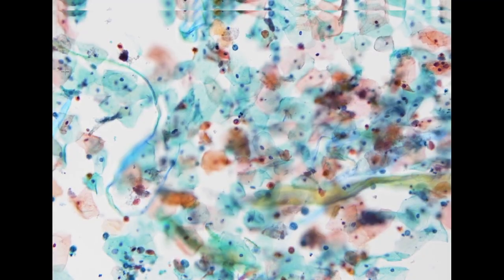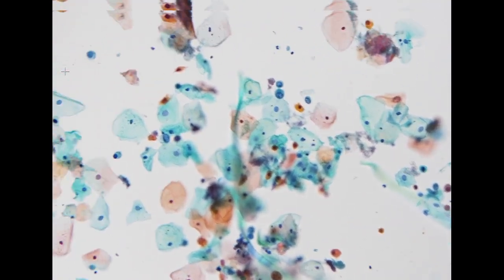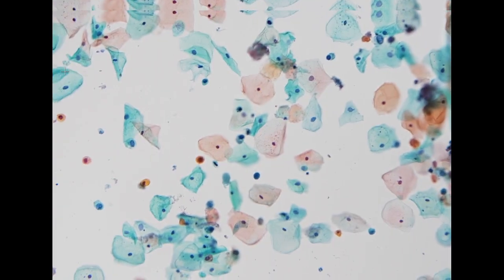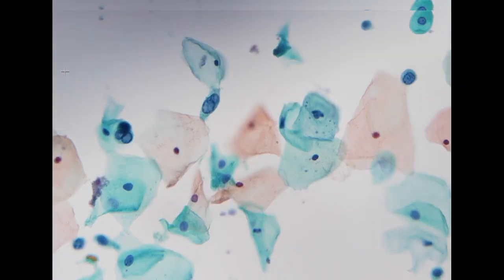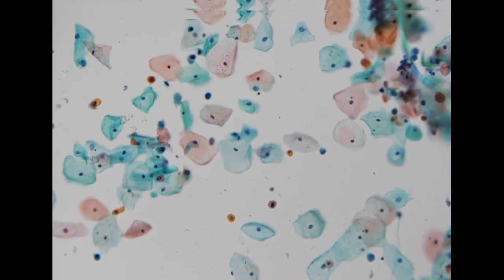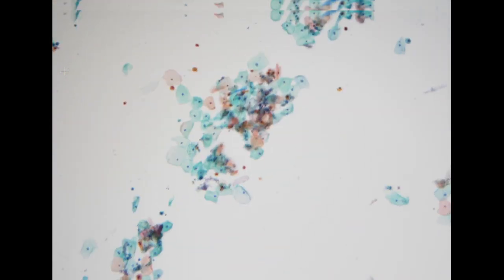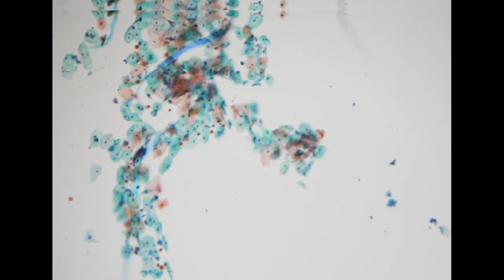So for an elderly female patient who presented with hematuria, the reason for the hematuria might not be just coming from the urinary bladder, and it can also be the first presentation, particularly for cervical cancer. So when we see a urine specimen with prominent squamous cell contamination, and then we also see some atypical squamous cells that in a pap smear we would at least call ASCUS, we should pay attention. For this type of specimen, usually we will call this atypical, with the presence of atypical squamous cells, and we will suggest the clinician ask the patient to go to the gynecology department for a pap smear.